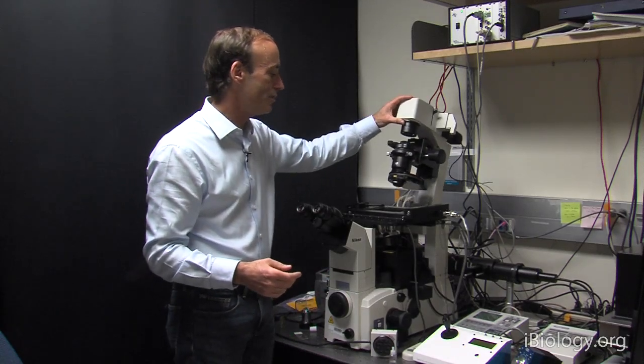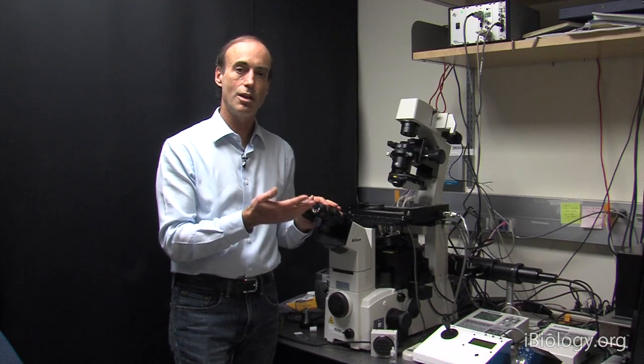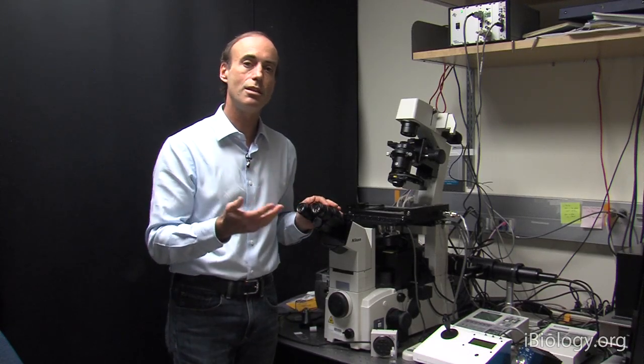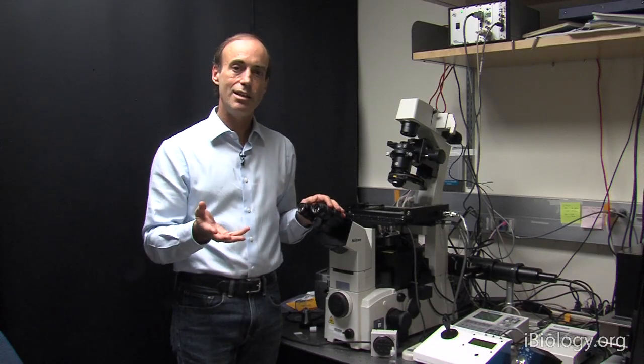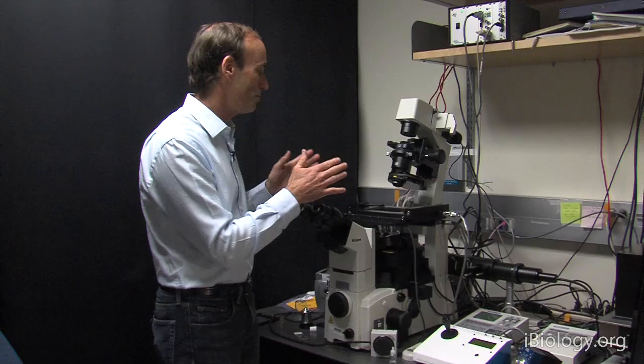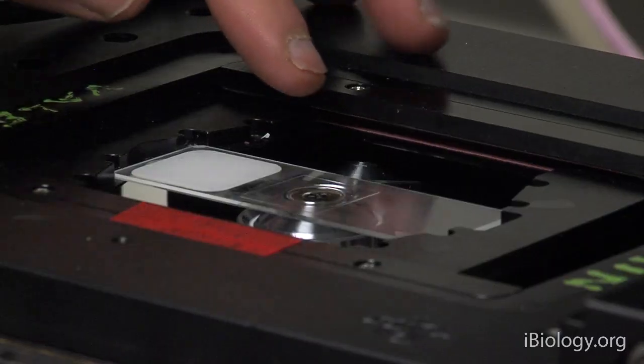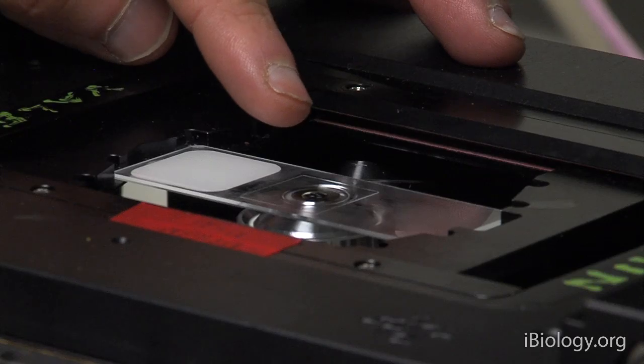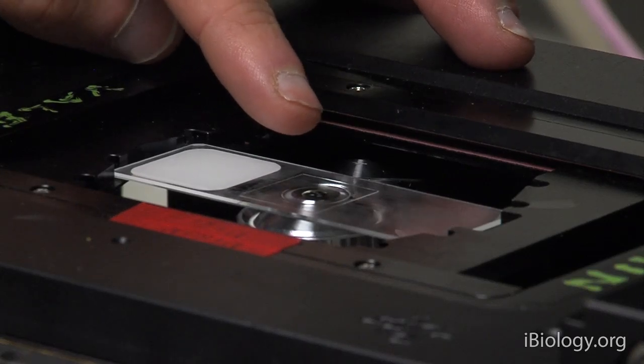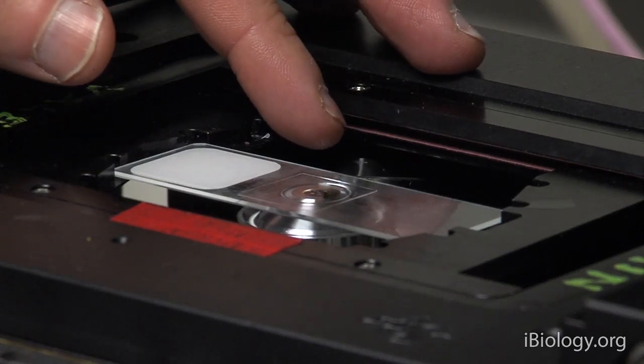Finally, in some cases, you may have a very difficult time focusing on your specimen, and you may think you've gone too far. If that's the case, it's good to stop at that moment and look at the specimen to see if you indeed have overfocused. You can see this happening right here when we've gone overfocus, and now the objective lens is actually pushing up on the entire slide, lifting it up.